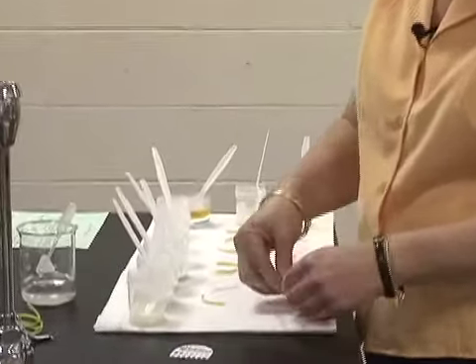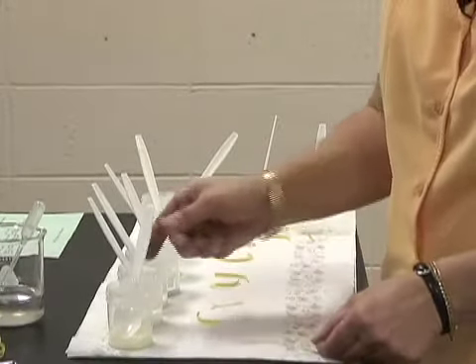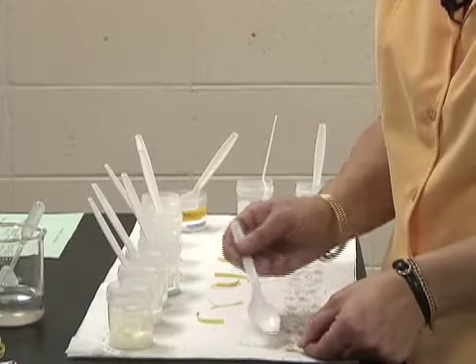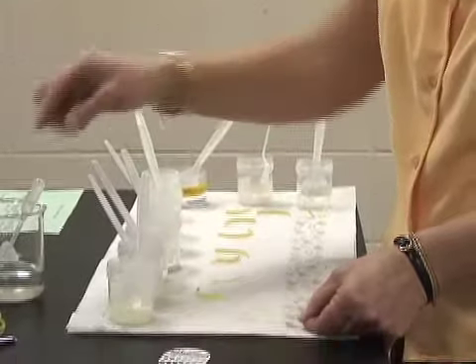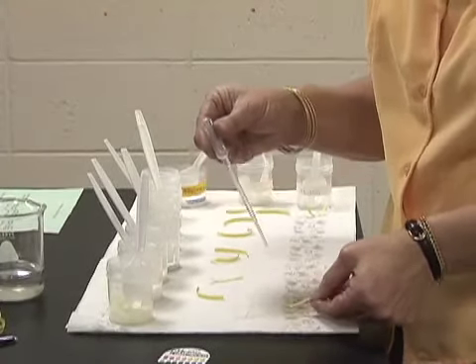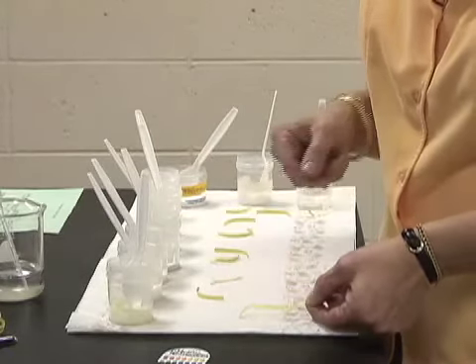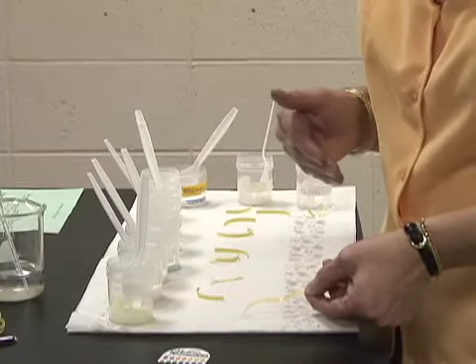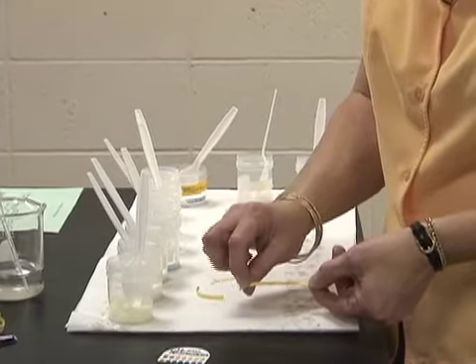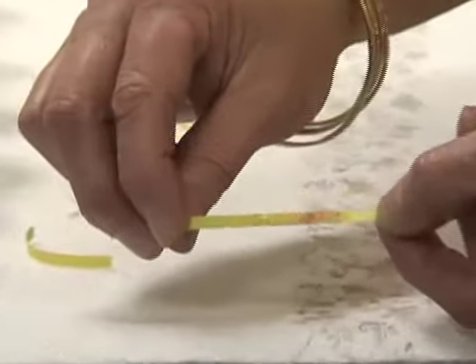The first salt, I'm going to go in order that they're given in the lab. And the first one is aluminum chloride. So I will add a little bit of aluminum chloride. That's a little bit more than a little bit, but it's okay. And we'll do a drop of water and see how this changes. I need to give it a few seconds, and I can see that there is a color change going on here as it's reacting with the paper, and it's getting to be a red.